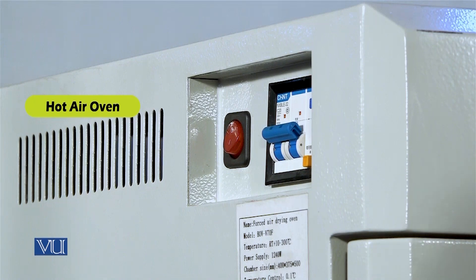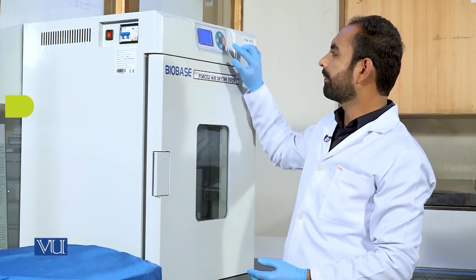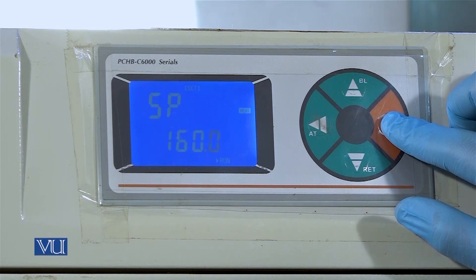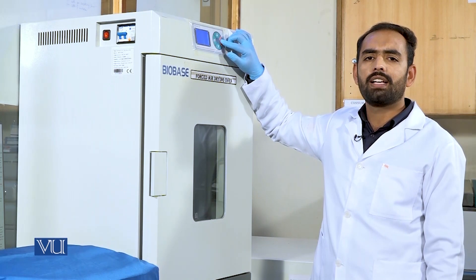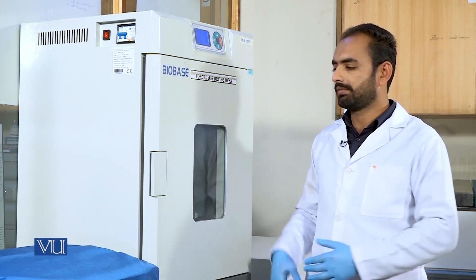First, in dry heat sterilization, we will start with the hot air oven. A temperature of 160 degrees Celsius for two hours is sufficient for sterilization. Hot air oven is usually used to sterilize glassware, forceps, spatulas, and pipettes.